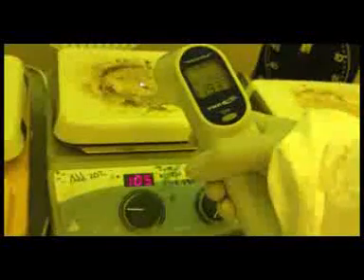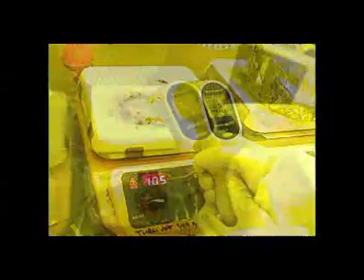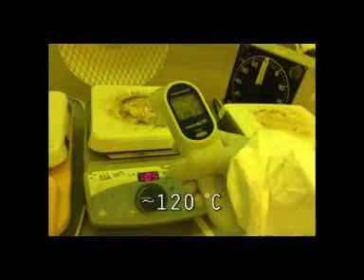The readings on all of our hot plates are wrong, so double check with the infrared thermometer. You need to set three hot plates, one to 65, one to 95, and one to 120 degrees Celsius.